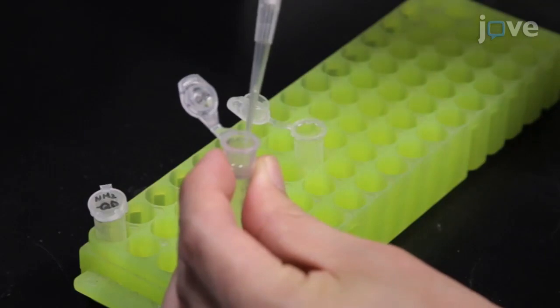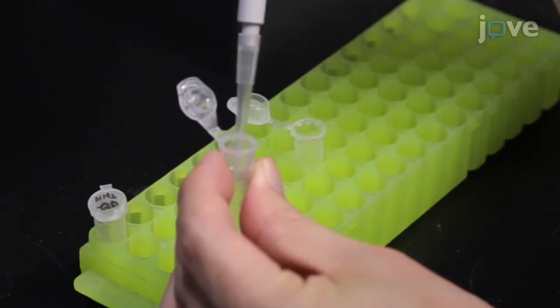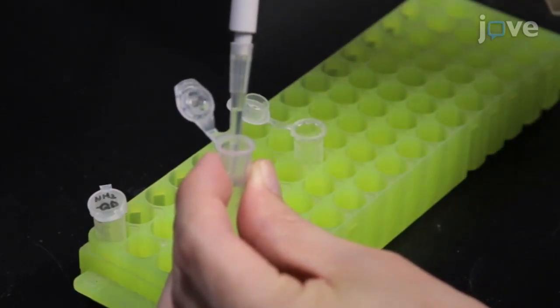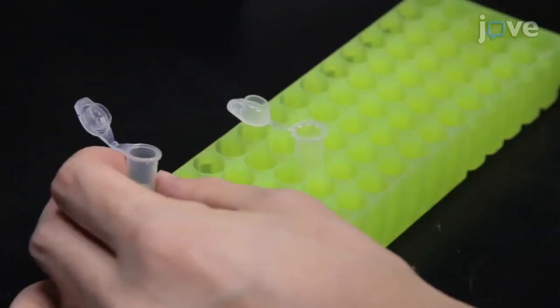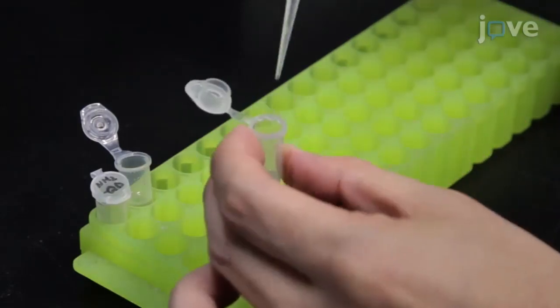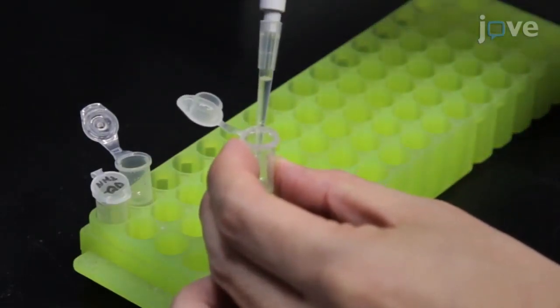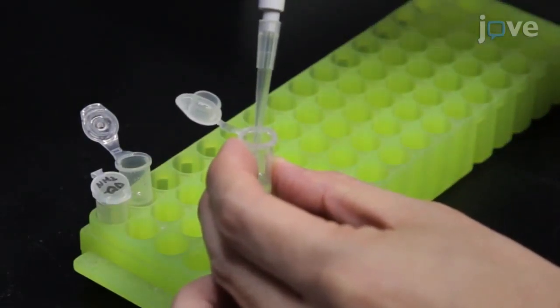To accomplish this, add 100 microliters of 125 micromolar azide PEG4 NHS ester in DMF to 400 microliters of a DMF solution containing 500 nanomolar of quantum dots that are coated with amine functionalized PEG.